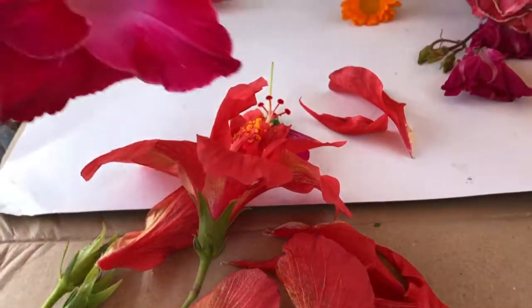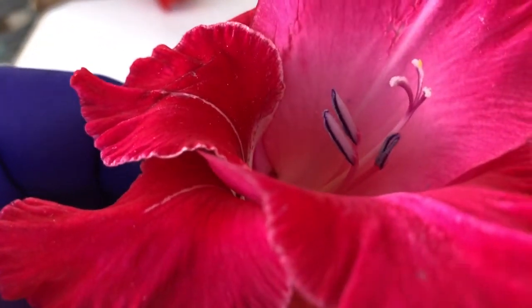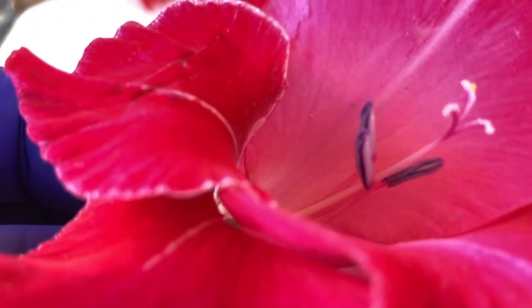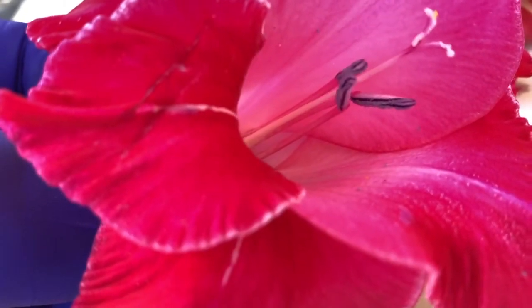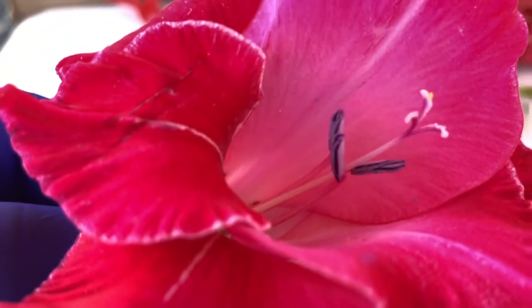Now, again, the flowers are very different, right? Some are very smelly, sweet smelling. Some might not be so sweet smelling, but they're still attractive by color or by the way that they are structured. In this case here, you see the longer purple things there towards the bottom part of the screen. Those are the male parts.